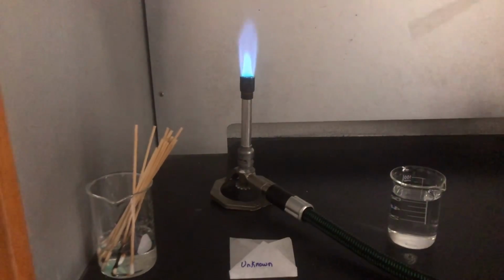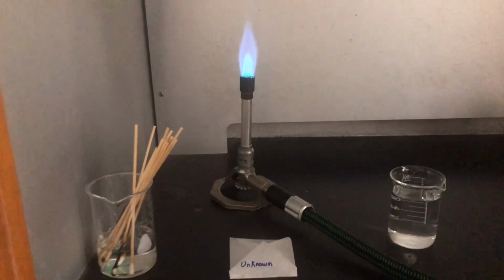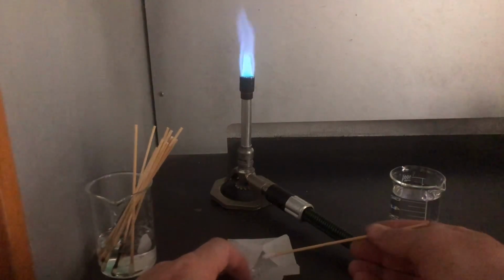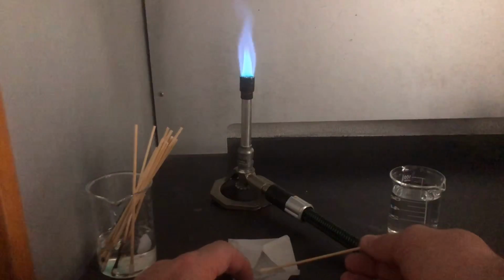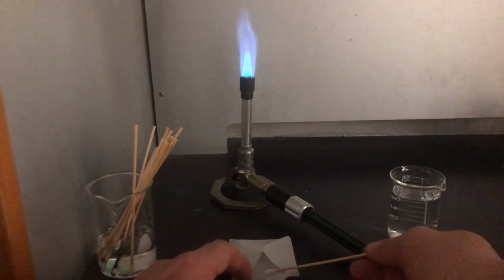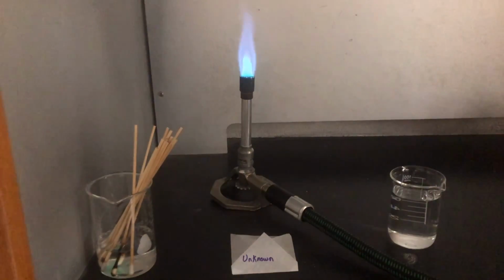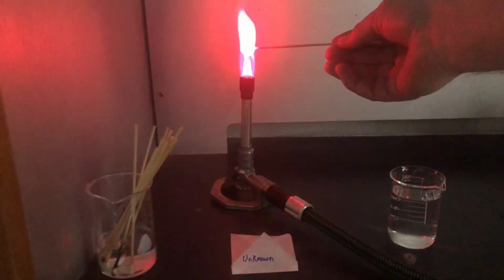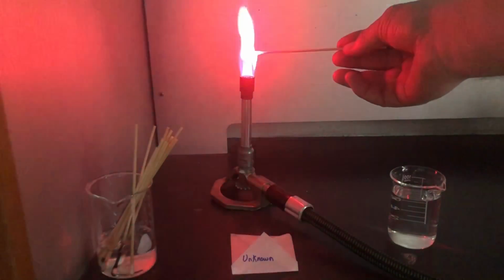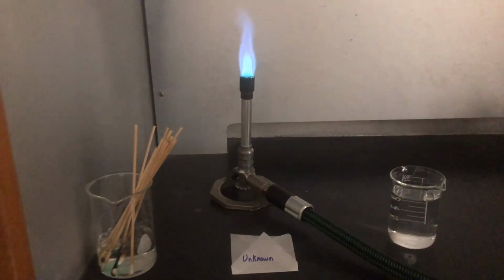So our unknown, this is it. It is not any of the ones that we've tested, but it does have either an anion or a cation that is similar to one that we have tested already. But again, this is not one of the other ones that we've actually gone through. It's a whole different compound, but it does have either the same anion or cation as one of the others. There's that nice, not quite a fuchsia, but it is a red color, isn't it? See if that works out for us.